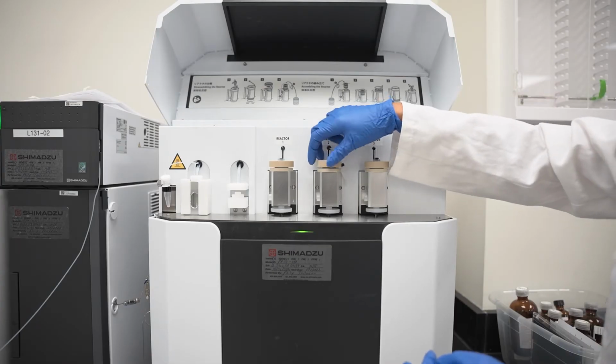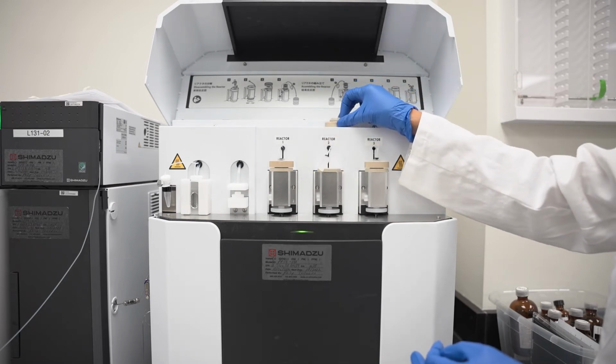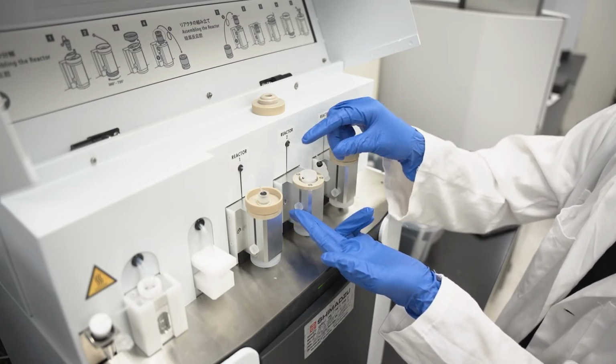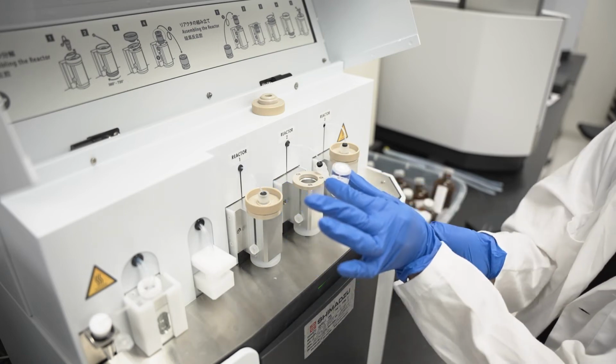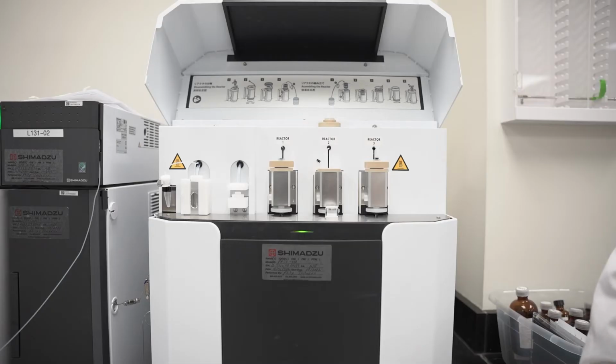You can also follow the instructions located on the underside of the lid covering the reactors on the PPSQ system. To remove the upper reactor chamber, push the toggle on the left side of the reactor block up towards the reactor block opening. This will move the set screws on the spacers that frame the reactor chambers and allow you to access and remove the upper reactor chamber and spacer.